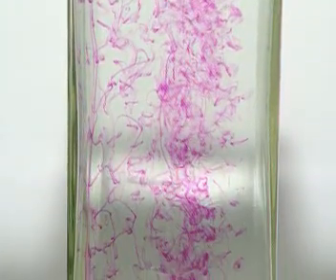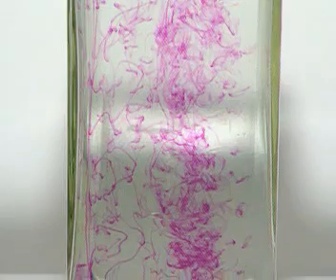Drop potassium permanganate crystals into water and they begin to dissolve. The purple solution then spreads out and diffuses through the water.